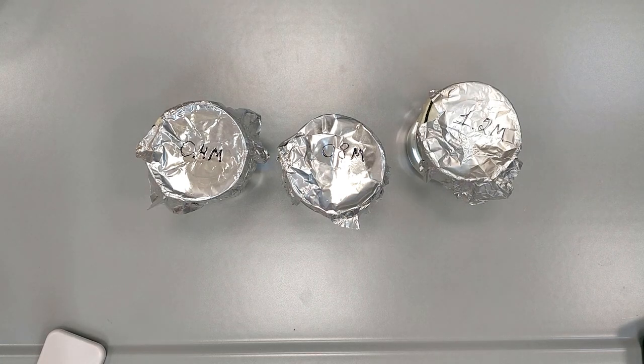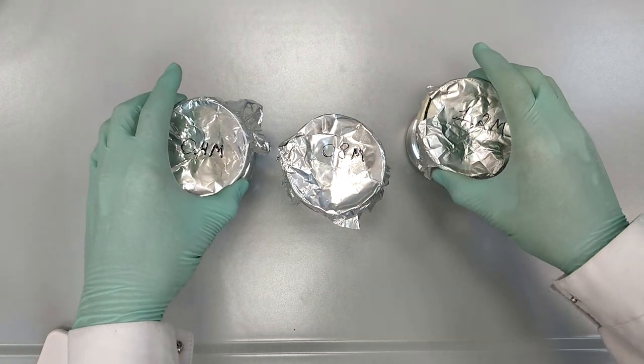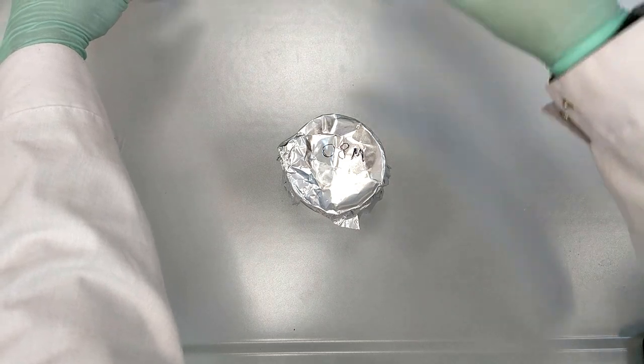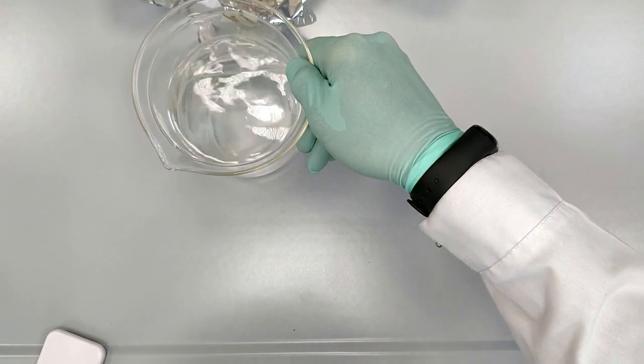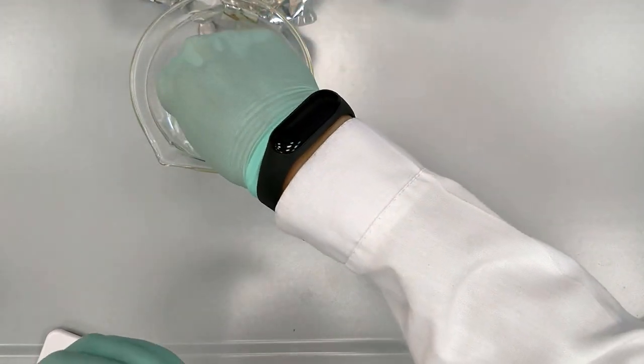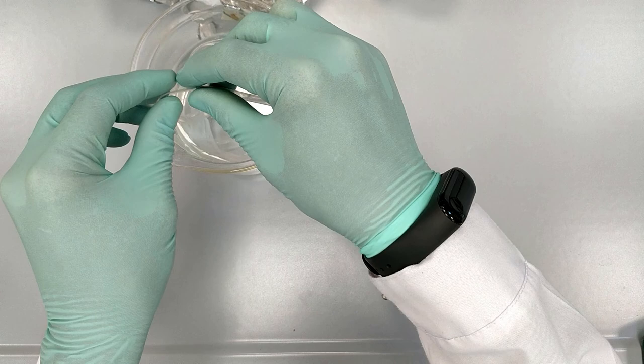Okay, since we have all the needed concentrations, we can proceed to the step of dialysis tubes. So we pre-soaked them in water, which means we just put them in water so that they become smooth and soft.